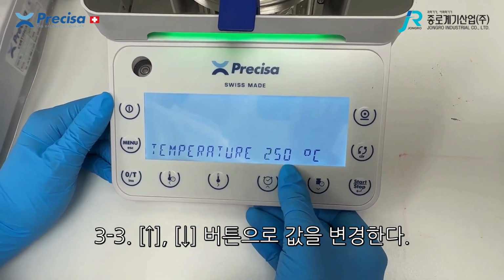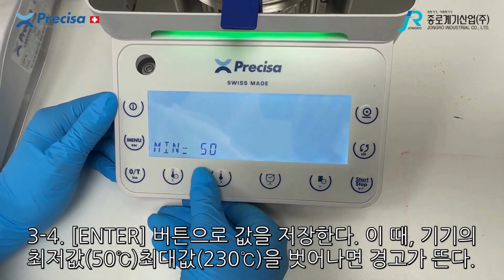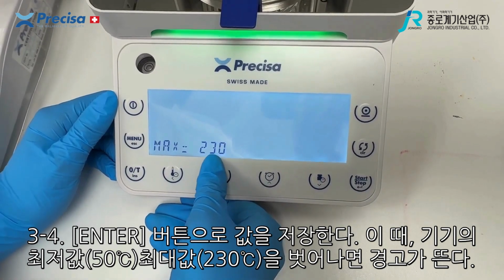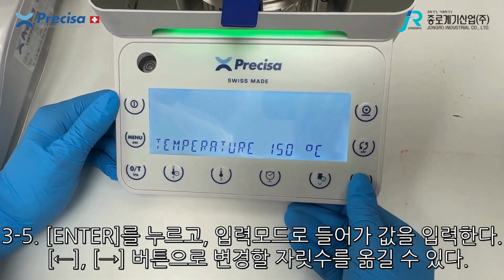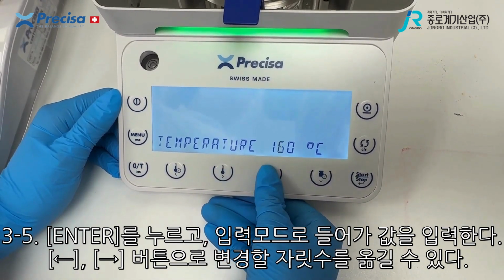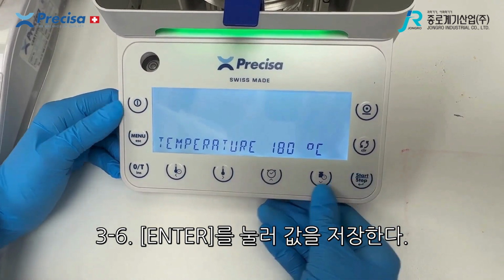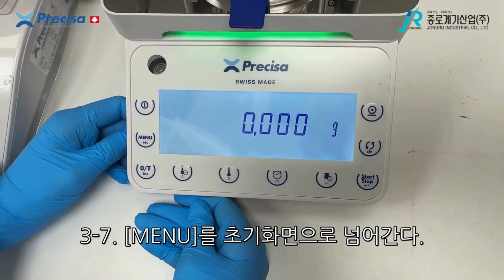If you select a temperature which is above the Moisture Analyzer's requirements and you try and enter it, it will give you a warning here showing that the maximum is 230. In order to change it, you can just scroll through, adjust the temperature accordingly, press enter to lock it in, and then menu to go back to the main menu.